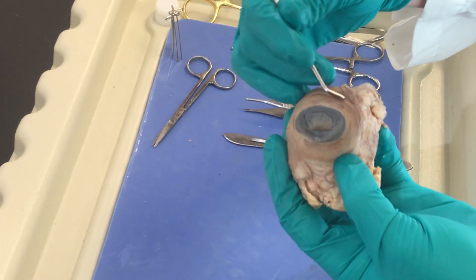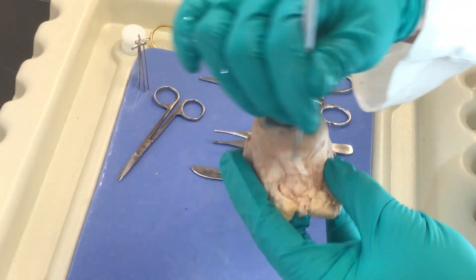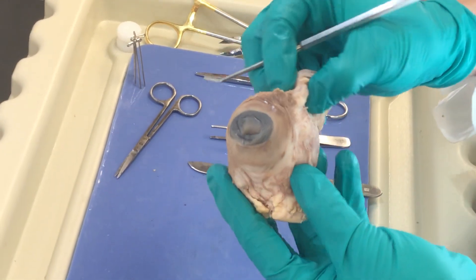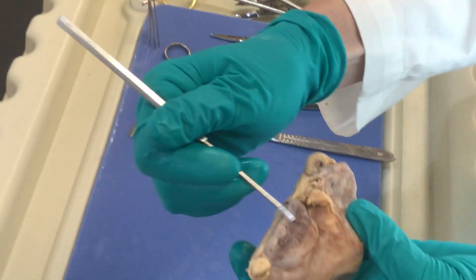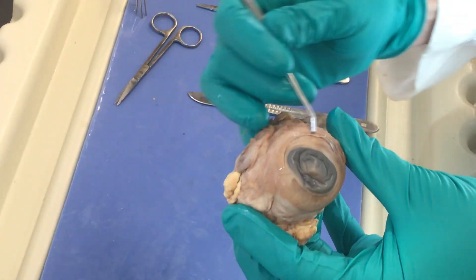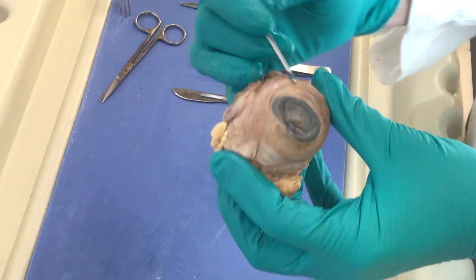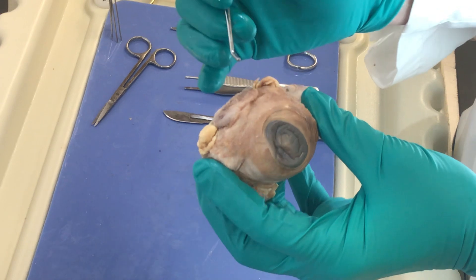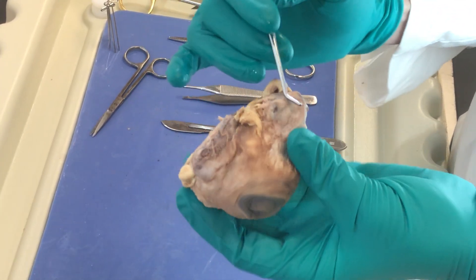This stuff right here is conjunctiva. Externally around the eyeball, we have muscles coming in and fat to support and cushion the eyeball, and you have your extraocular muscles. The sclera is very important for attachment of the conjunctiva, which carries blood vessels to these structures, and also for attachment of the extraocular muscles.